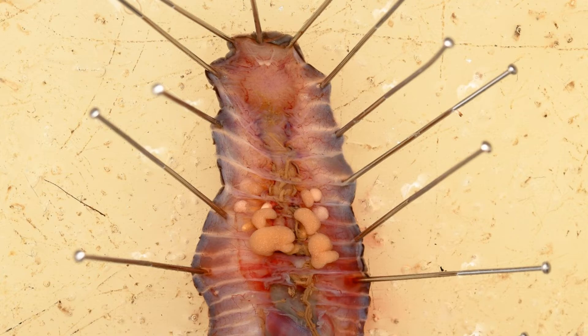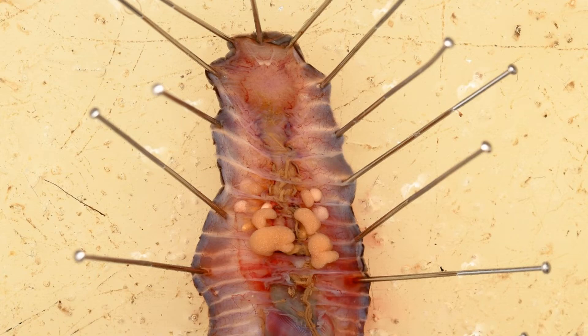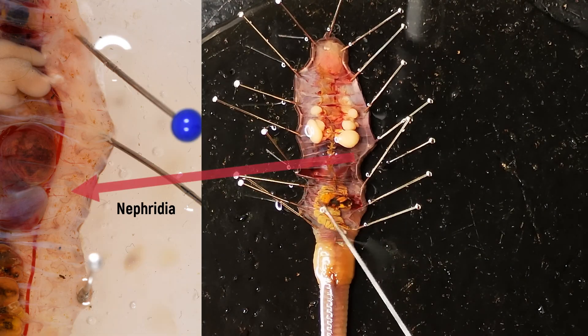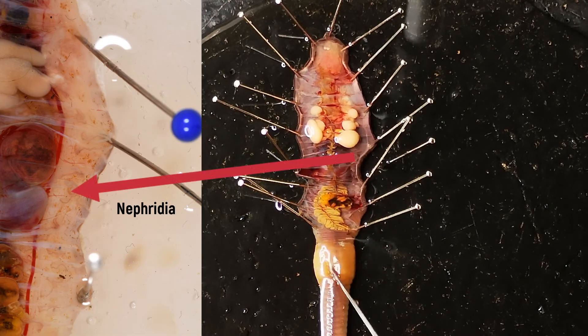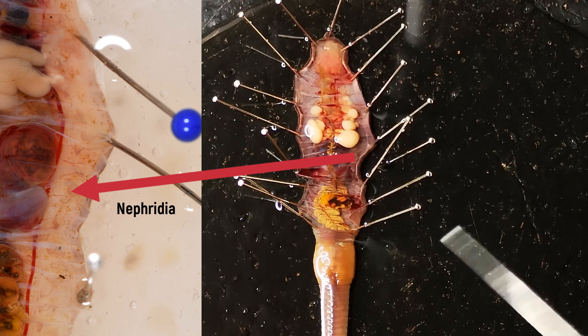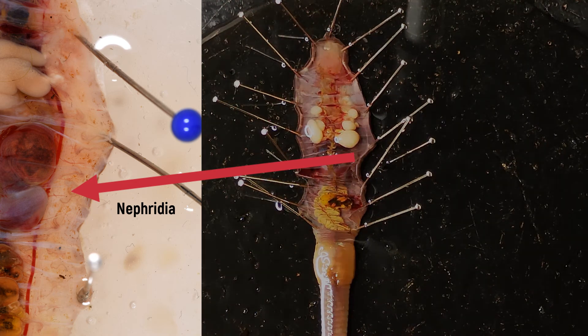You can easily find them and count the segments from there — that is, you can use them for orientation. If the specimen is covered with water, fine structures such as the nephridia or the suprapharyngeal ganglion can be seen clearly under the microscope.